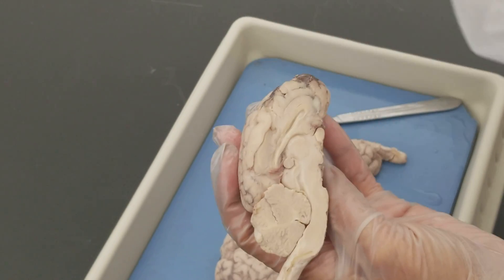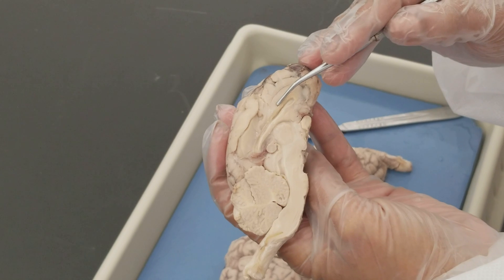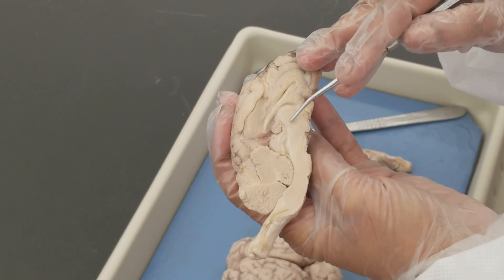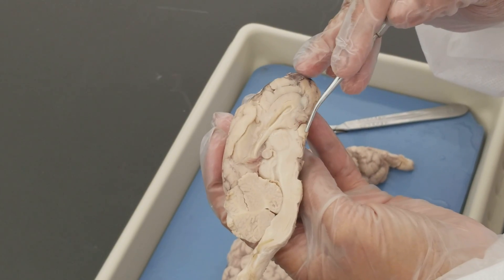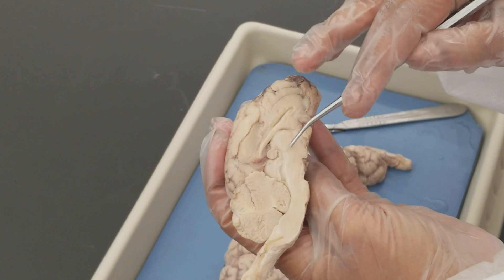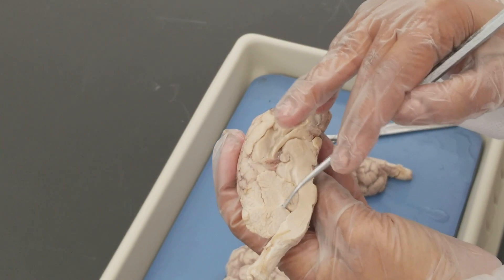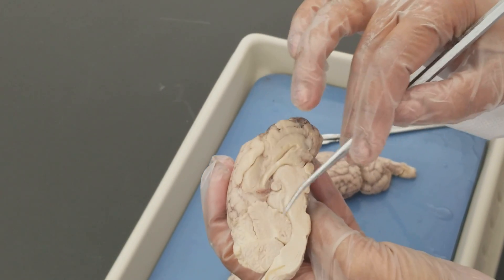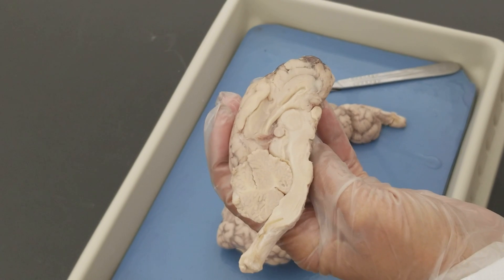We have now covered the major internal structures: corpus callosum, lateral ventricle, septum pellucidum, fornix, thalamus, epithalamus, pineal gland, optic chiasm, hypothalamus, mammillary body, third ventricle, cerebral aqueduct, fourth ventricle, central canal, cerebellum, arbor vitae, and gray matter.